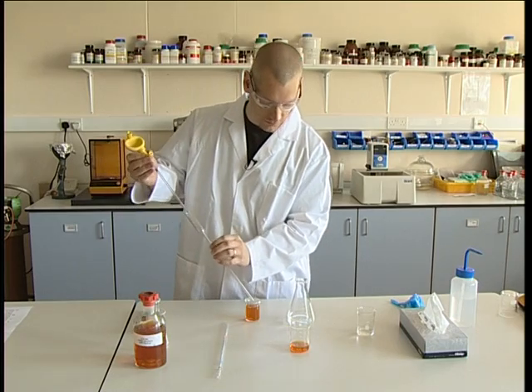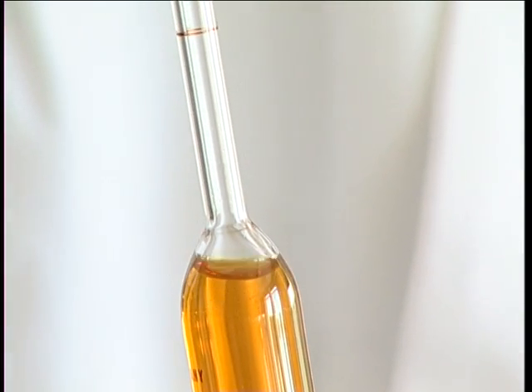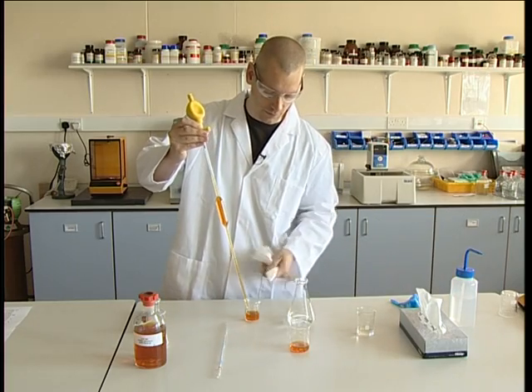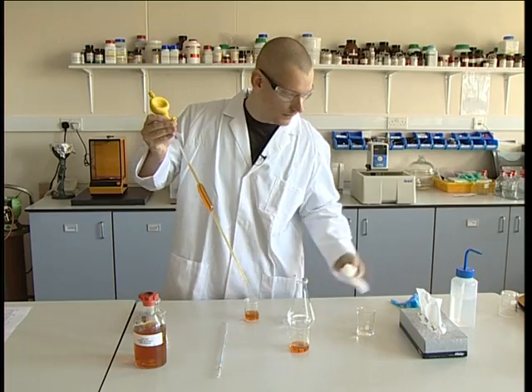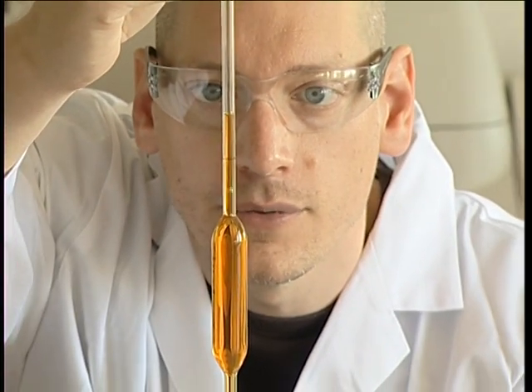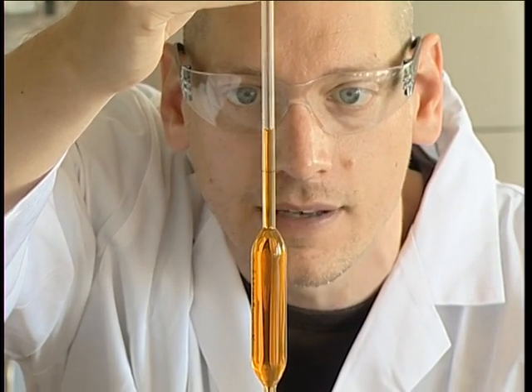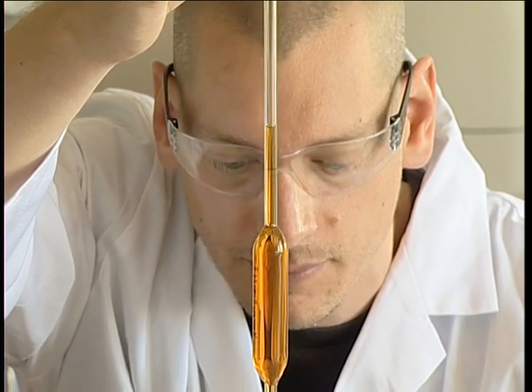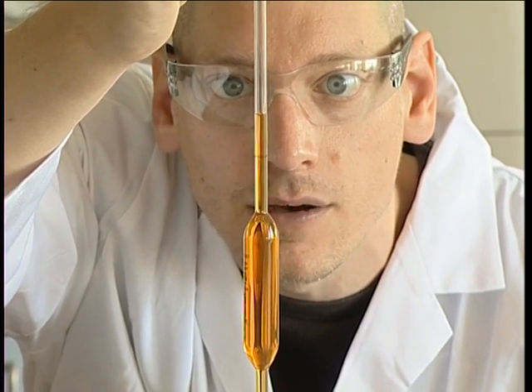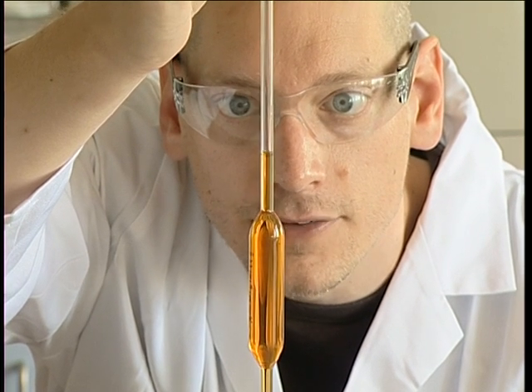Having cleaned the pipette, dispense a quantity of the stock solution to avoid contamination for other users. Taking the pipette, fill it up, taking the liquid beyond the graduated line by about two or three centimetres. We can then dispel the liquid coming down. First, wipe the pipette to ensure there's no residue on the sides of the glass so we can get an accurate volume. Ensure that you can see the graduated line and the meniscus of the liquid as it falls down to that line. If you're looking at it from above or below, you'll get a parallax angle that will affect the volume. So get down on the same level and allow the liquid to fall very slowly, drop by drop, until the bottom of the meniscus is at the top of the line.